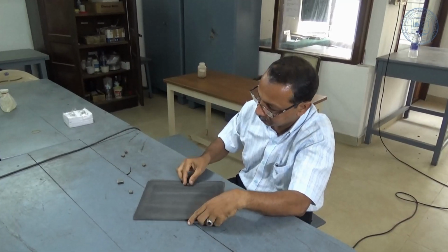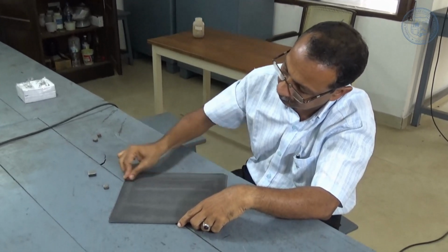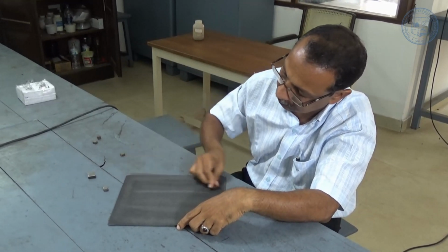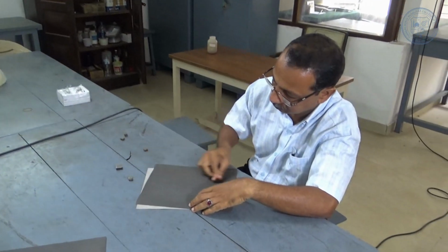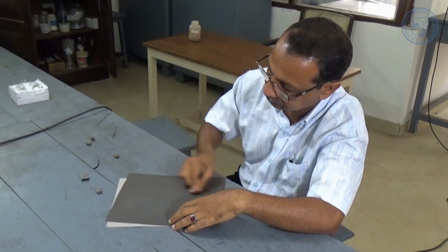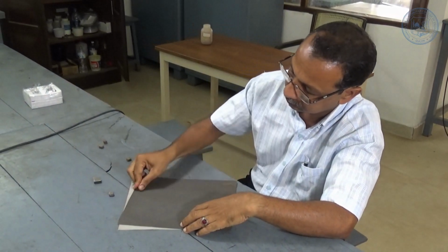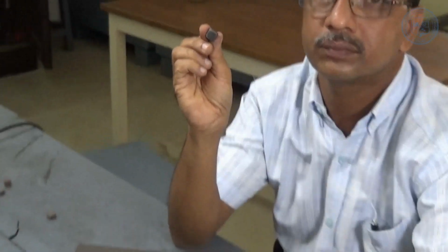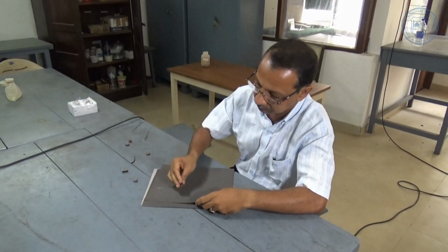When the sample is flat and the only scratches remaining are those due to the 100 grit size, move to the next paper, say 200 grit size. The direction of grinding is changed from paper to paper so that the removal of the previous grinding marks is easily observed. Repeat this procedure for different papers of grit size varying from 100, 200, 300, 400, 500 and 600, checking after each step to be sure that only those scratches remain that are due to the smallest grit.